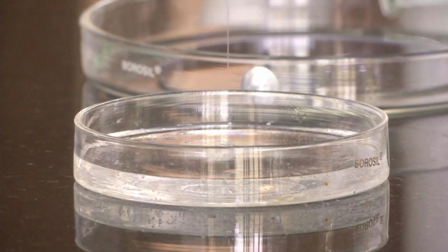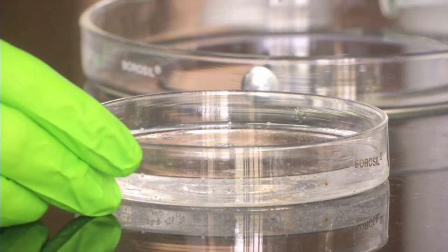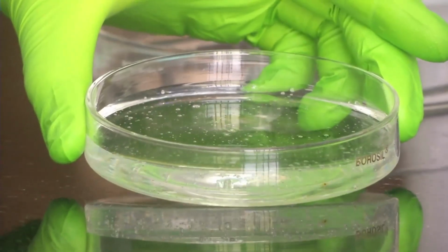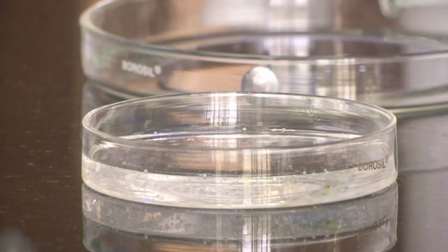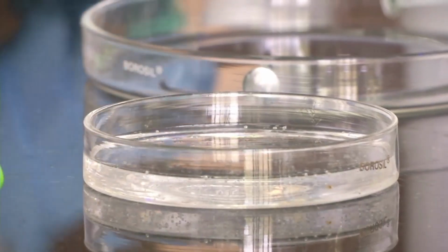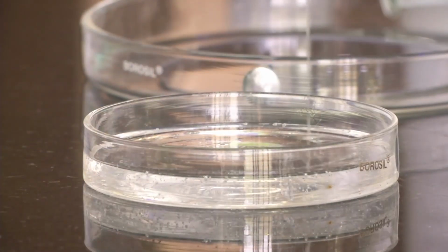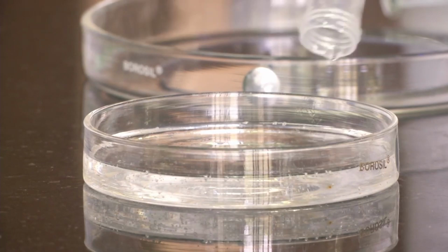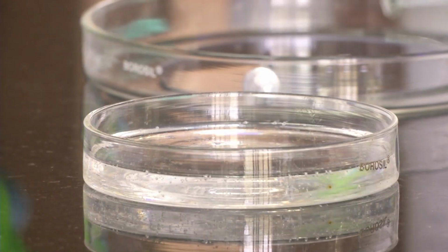That is why we will be using the desiccator which I explained before. I am just waiting for the whole PDMS to get poured because we have measured 50 ml. So, let us get the maximum from the tube to the petri dish. If I tilt the petri dish, you will see lot of air bubbles in it. So, these air bubbles have to be removed at some point. Now, we are adding the 5 ml curing agent to this mixture. So, we have added 5 ml curing agent.